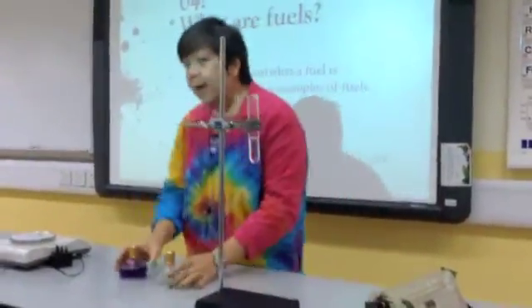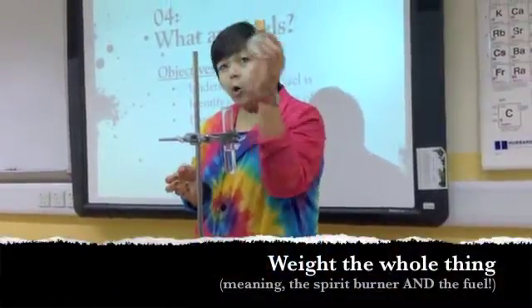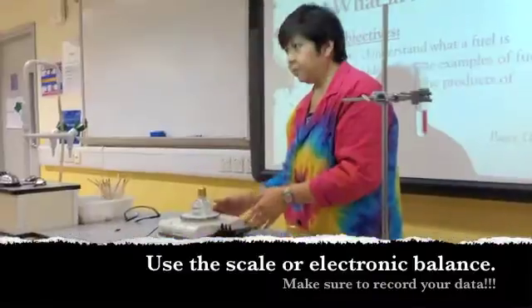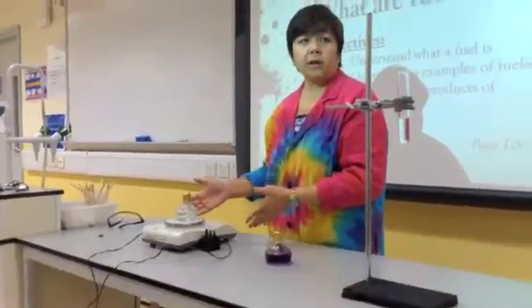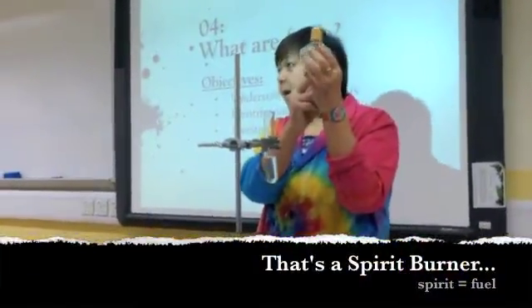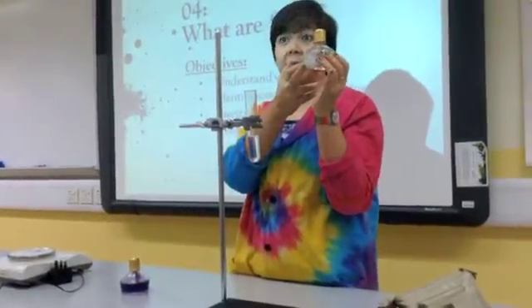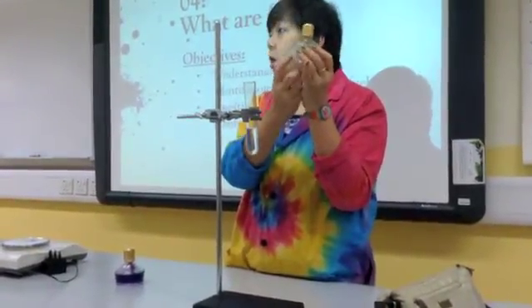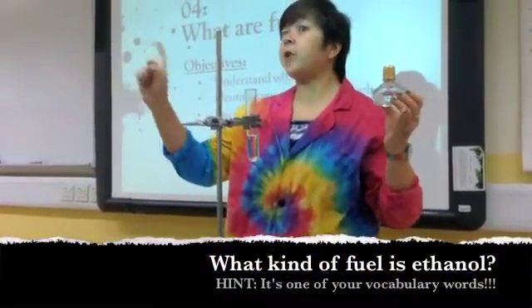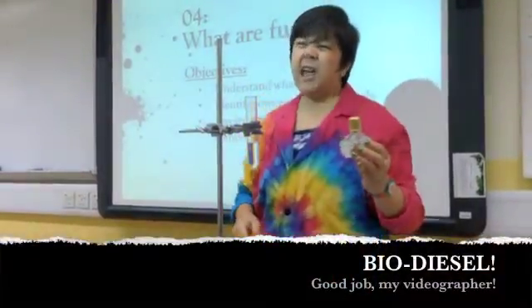In order to find out, what you're going to do is weigh the whole thing. You use the scale, read it off, and record it. This is called a spirit burner, by the way — it's a spirit burner because what's in it? Spirits. Ethanol is a spirit; it's a fuel. What kind of fuel is it? It's part of your vocab test — biodiesel.